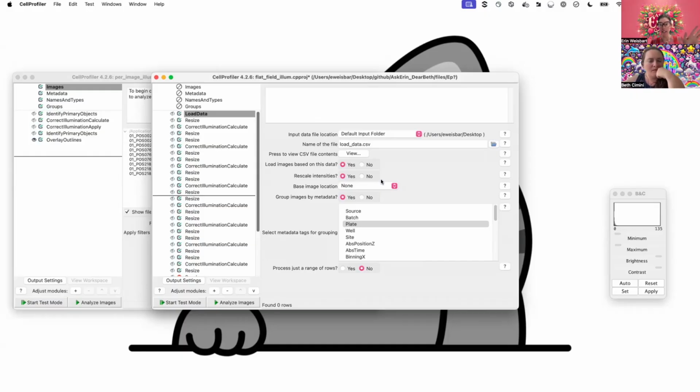So this kind comes with two major caveats. One, we are calculating this post hoc. One could actually do this on your microscope, and I'm not covering anything that would be happening in the wet lab. So this is what you would do if you had a set of images post hoc that you wanted to illum correct. Also, this particular method requires you to have many images, and it requires that the things in your images are randomly distributed across the image.